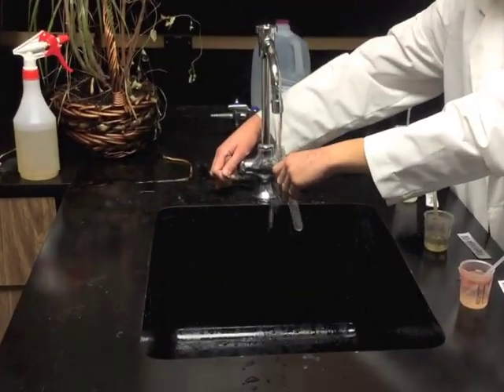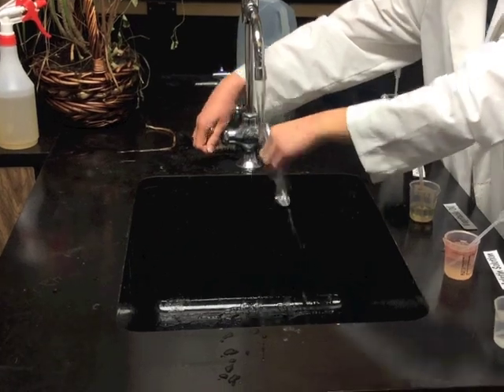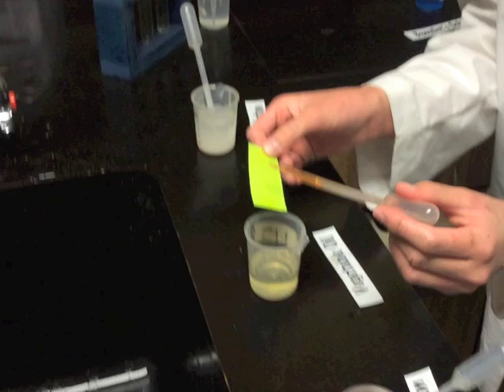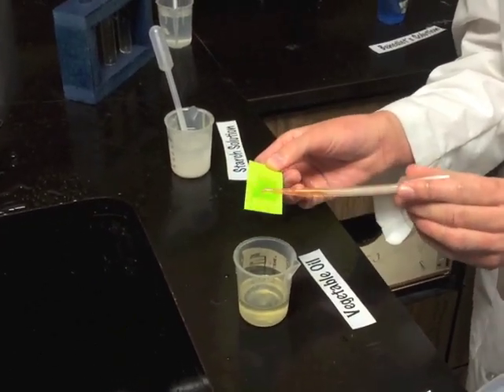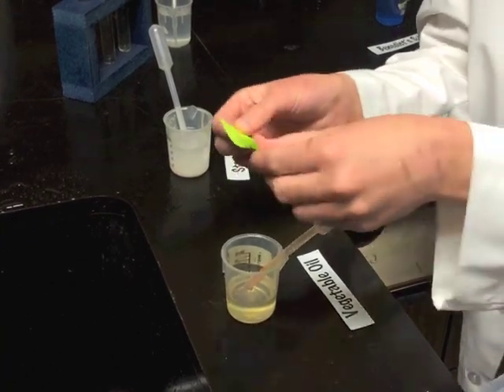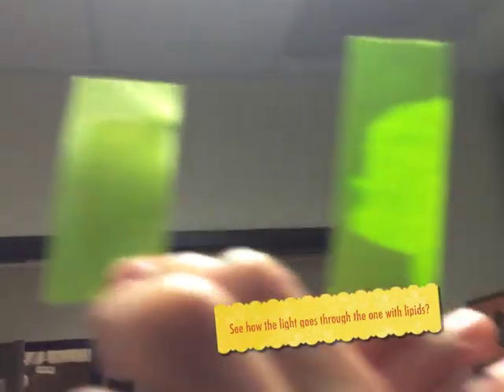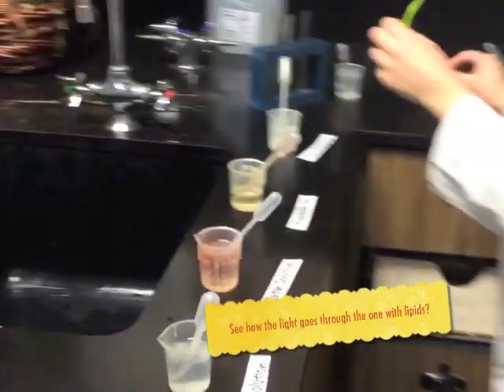Dump out your tube again and rinse it out. For the lipid test, get a piece of green paper and rub some vegetable oil all over it. You'll notice that it becomes translucent — you can see light through it. Compare that to water: if you rub water on the paper, it is not translucent, but the vegetable oil is.